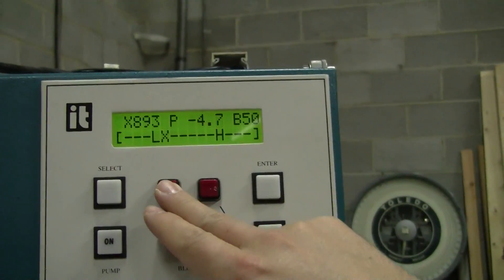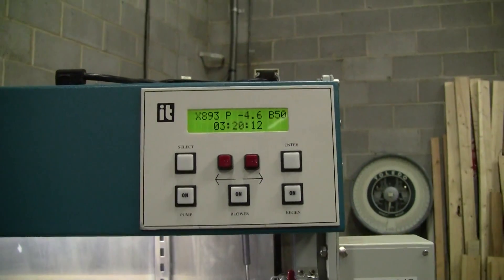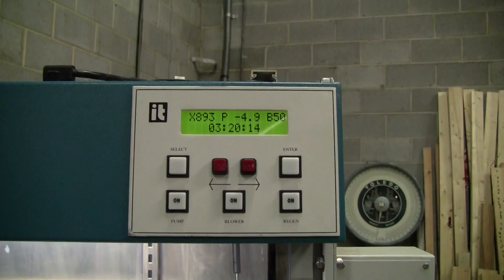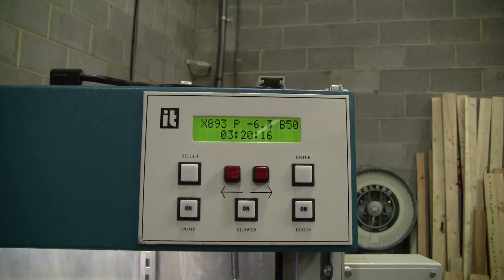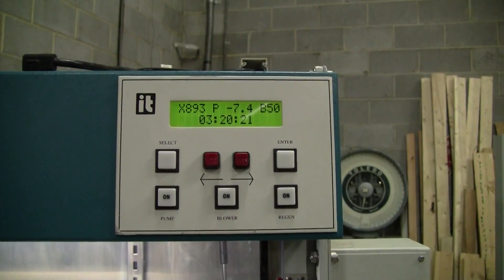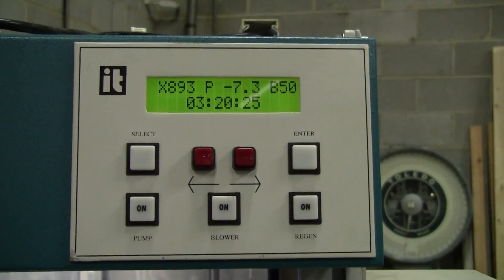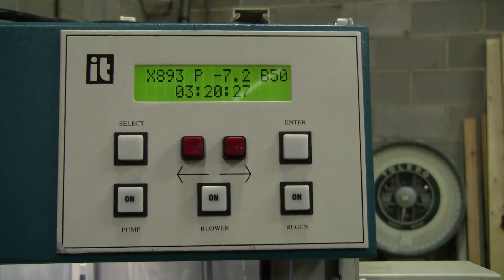Here we're looking at the vacuum in the actual chamber. I'm going to hit the foot pedal — you'll see it draw down. There is no additional air supplied to the solenoids as back pressure, so that's why it is going down at a steady rate.